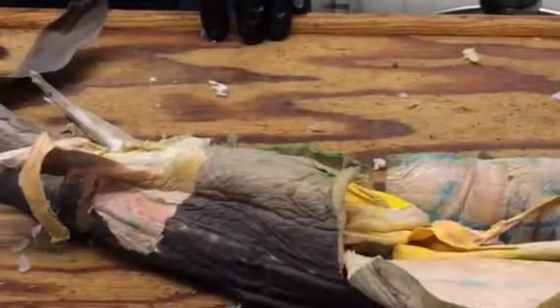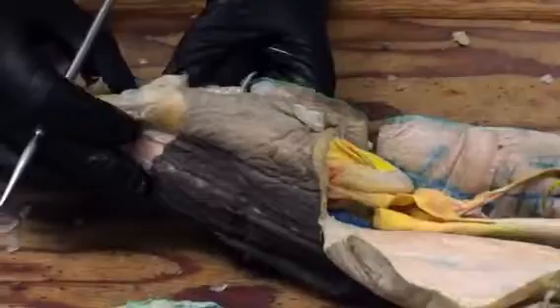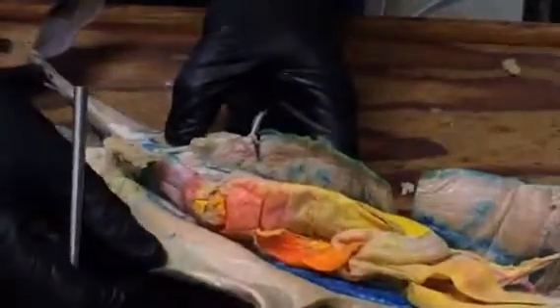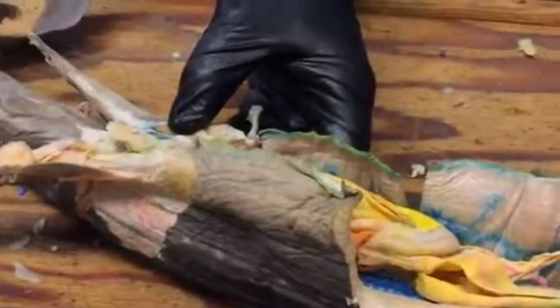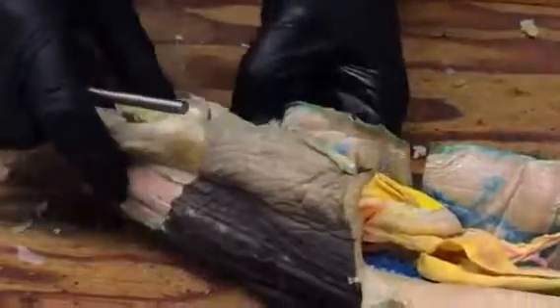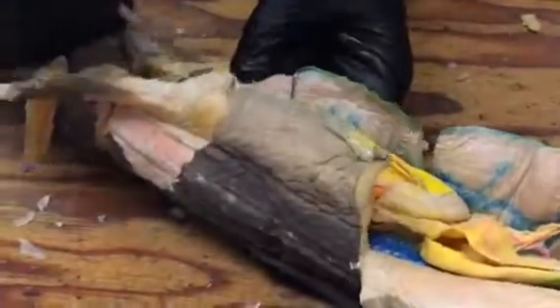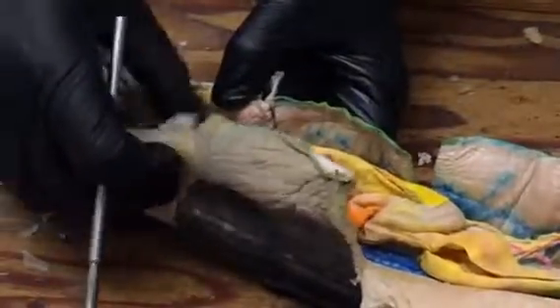Okay. Oh, and femoral arteries and posterior ventrolateral arteries. So I was a little overly ambitious in giving you those. The femoral artery is just the name for that iliac artery when it enters into the pelvic fin; it's called femoral at that point. The posterior ventrolateral artery, again, is going to be in the ventrolateral body wall posteriorly.